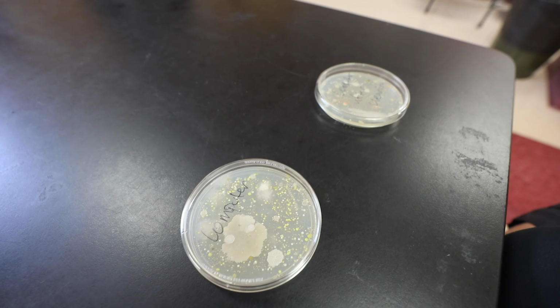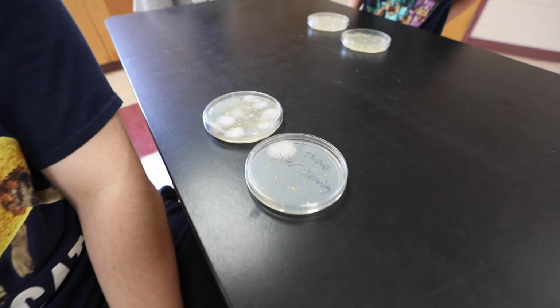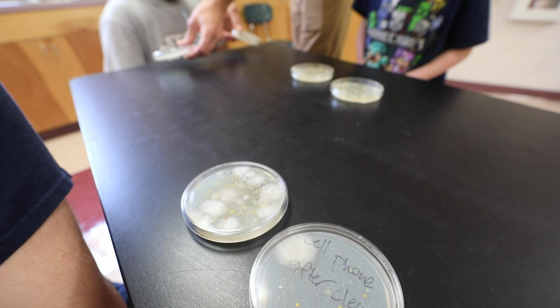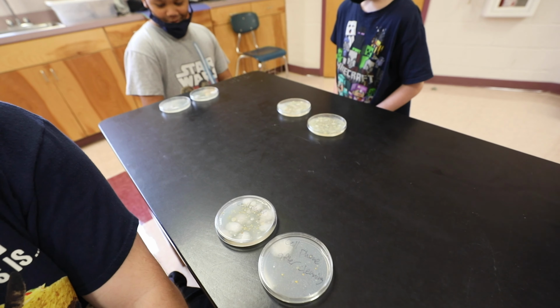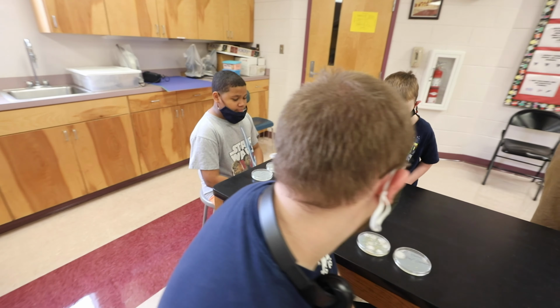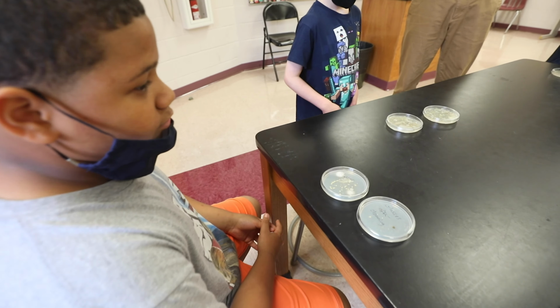Wow. Okay, well, I guess you're not touching the cell phone again. Keys. Don't touch them. So this was the cell phone? Yep. And you're suggesting I never touch it again? Yeah, it looks a little... Well, you cleaned it, and it looks a little better. But you know, all this happened in just a week. Look at all those germs. Was any of that on there when we left last Wednesday? No. So obviously it grew from whatever was on your Q-tip that you put on that surface.